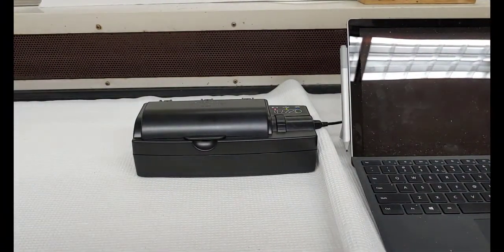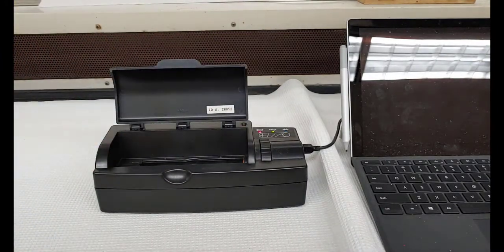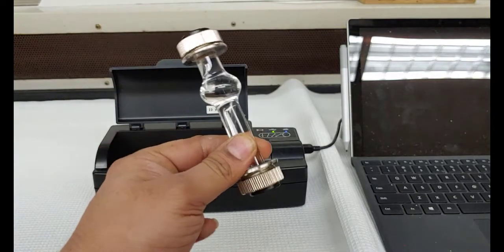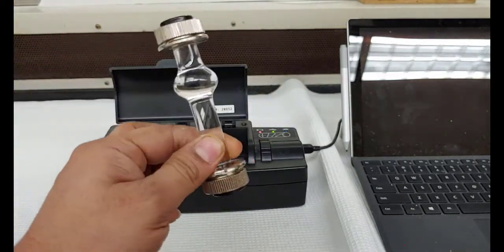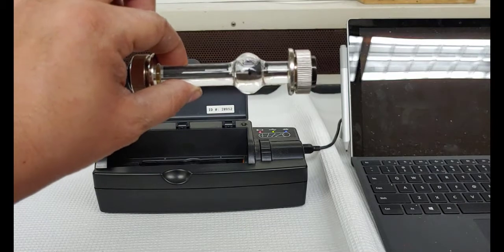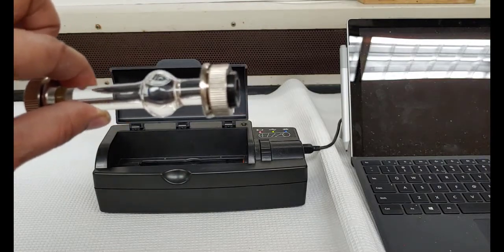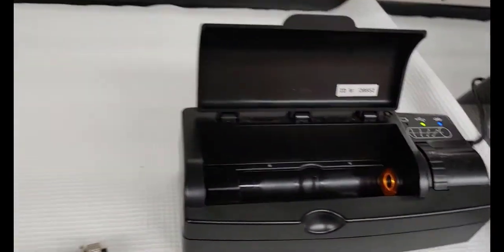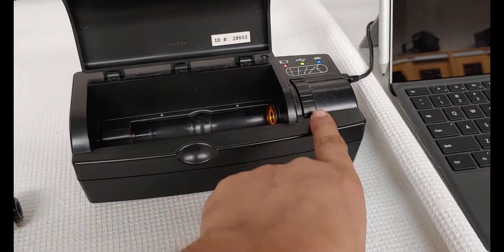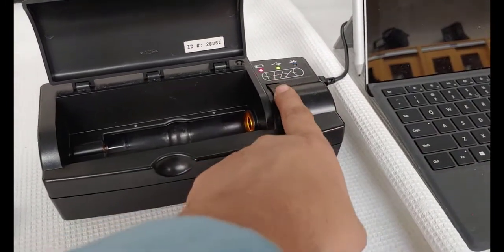Now this is a modern polarimeter, and in this device the sample goes in this chamber and the tube which holds the sample looks like this. So in this tube I have water, and please keep in mind that water is not an optically active molecule, which means that it does not have any chiral center. So this tube or water in this tube is not going to rotate the plane polarized light. And you can see here that there's a light source, and then there are polarizers here, and we can rotate just like the other instrument to match the plane polarized light.